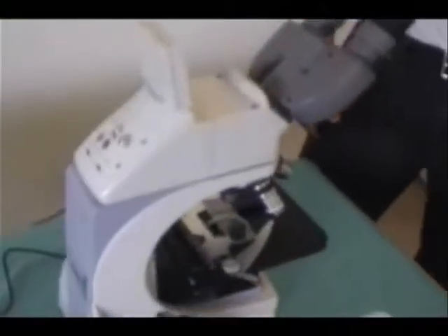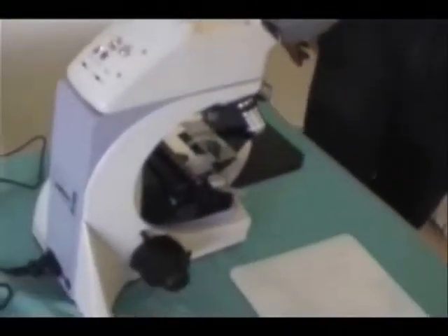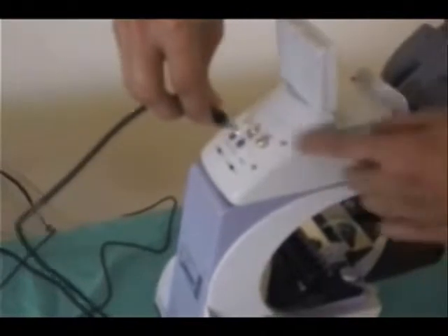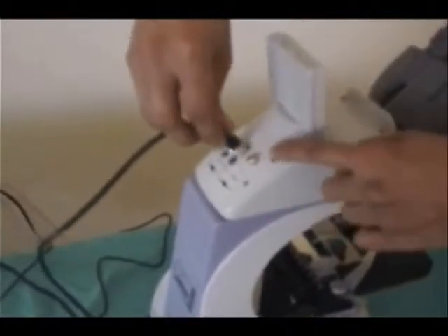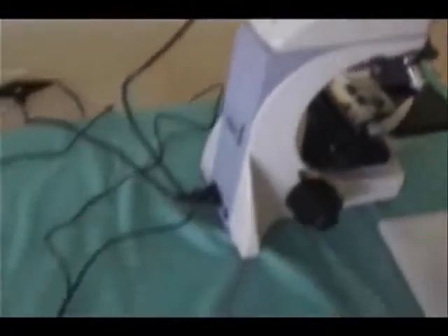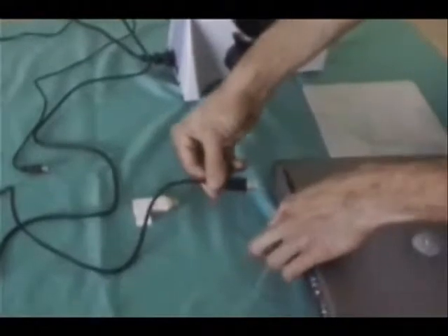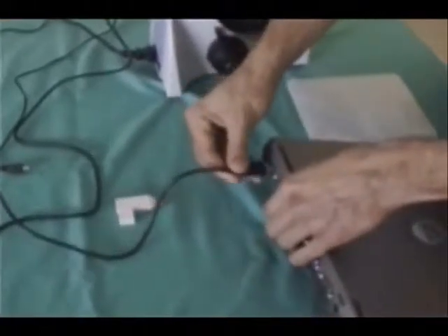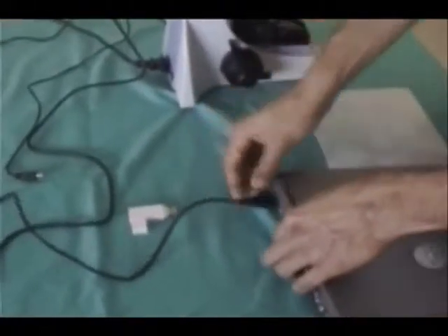Hello. Now, I'll demonstrate how you connect the microscope to your laptop or computer. This might look simple, but I'll walk you through it. This is a USB cable that comes with the microscope. What you want to do is connect it back here where it says USB and connect it also to your computer.